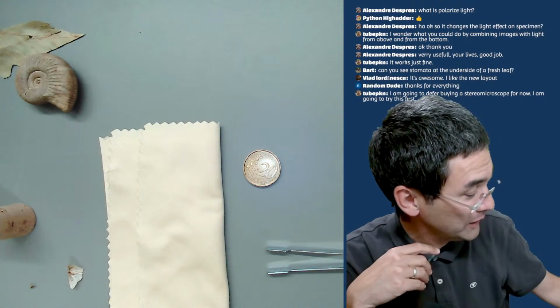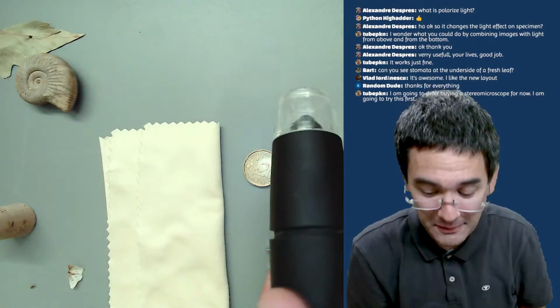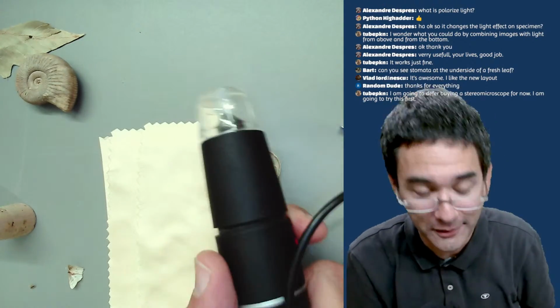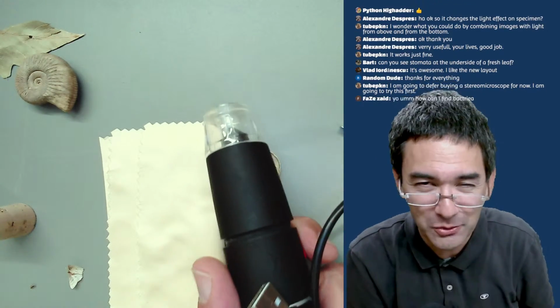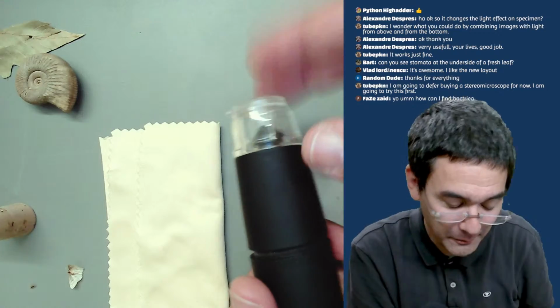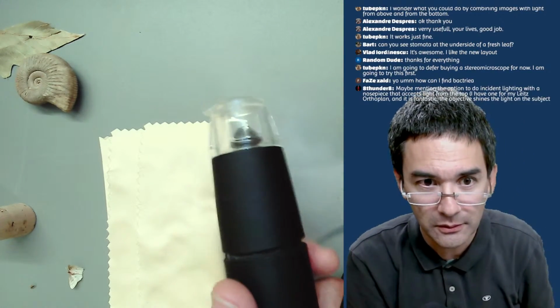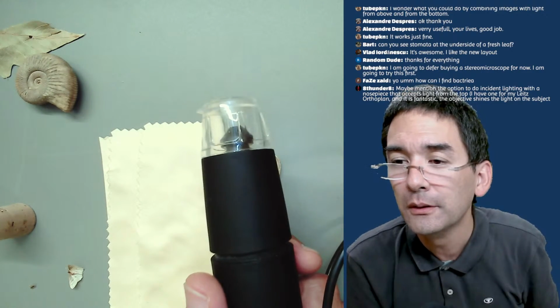And if you really want to, and this is really a pity that I couldn't get it to work on my USB port here, but this one over here, I got it from China a couple of years ago. I think it was €7 or $7, really cheap. There are much better ones, but for playing around, this is actually quite fun.